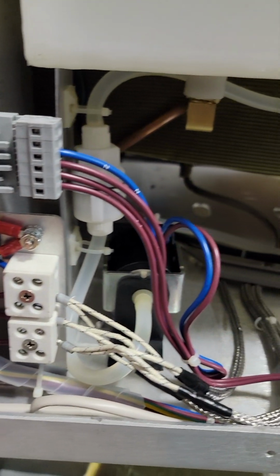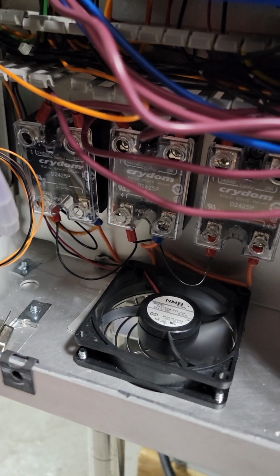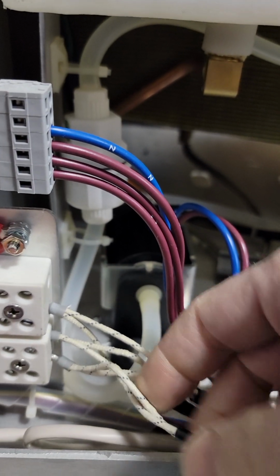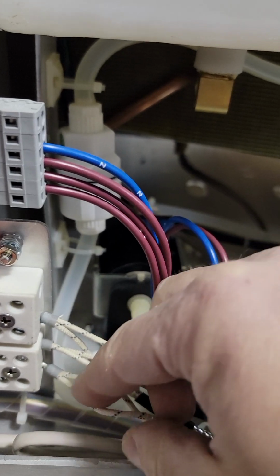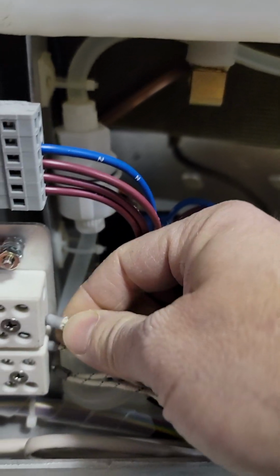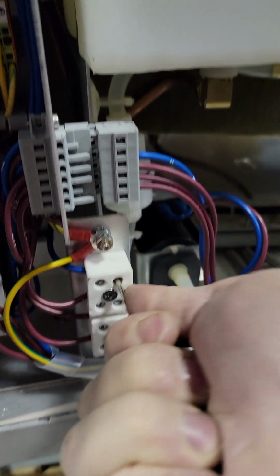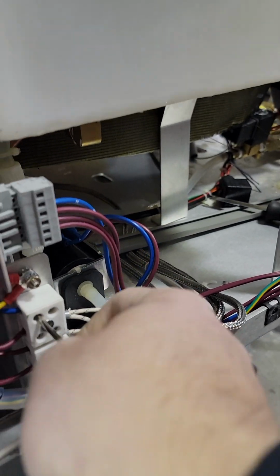Anyway, I've been having some issues with the heating, and I did some troubleshooting. I know it's not the SSR, it might be the contactor, it might be a heating element. I can't test the heating element because each heating element is crimped to the next one, and I don't want to have to cut these off. So I was hoping they were going to tell me some easier way to do it. So that's not good. Anyway, I'll put some funky voltages here.